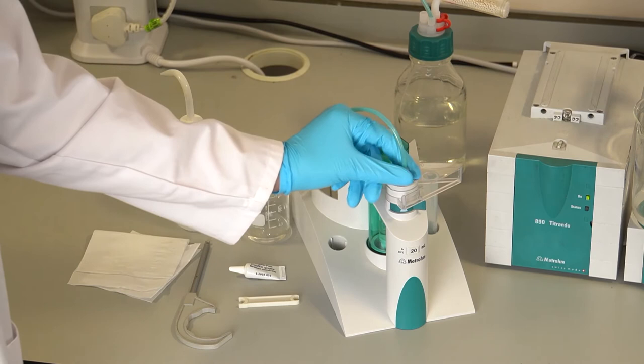Carefully support the base in case the o-rings are damaged then remove the glass cylinder.